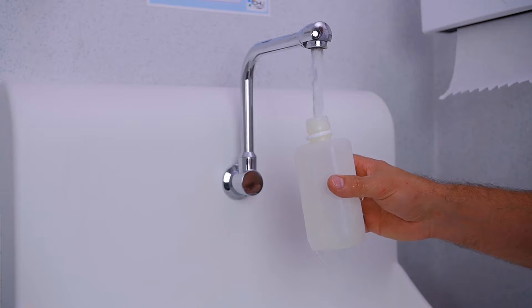The bottle mustn't come in contact with any external element during the filling procedure.